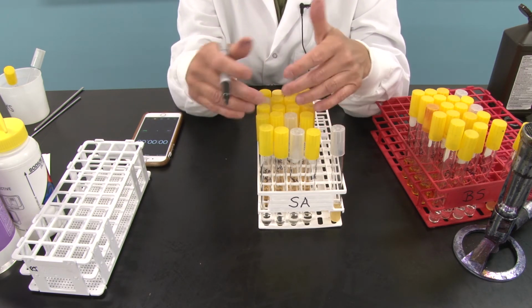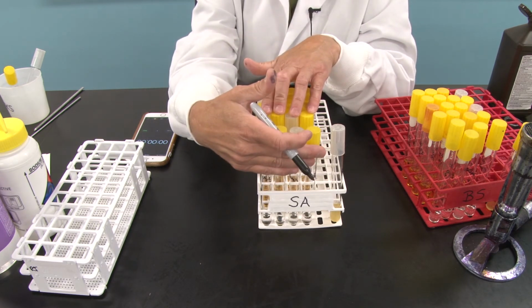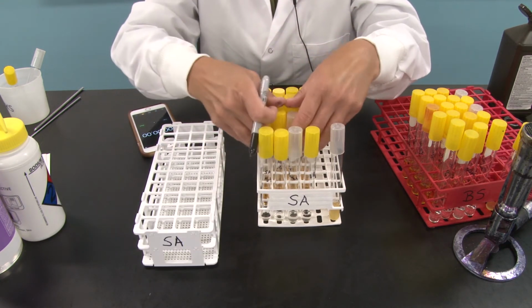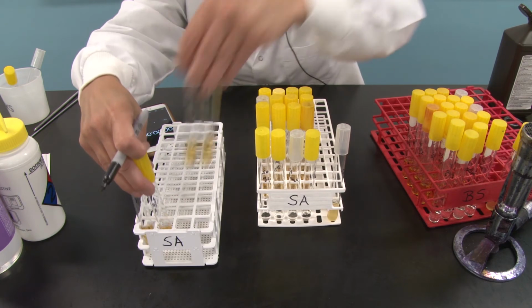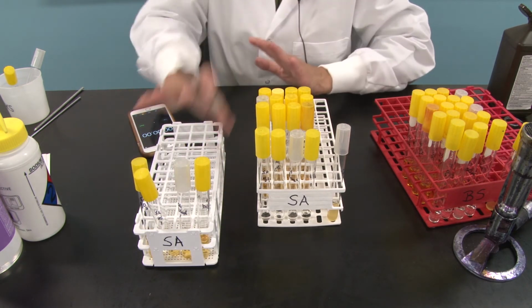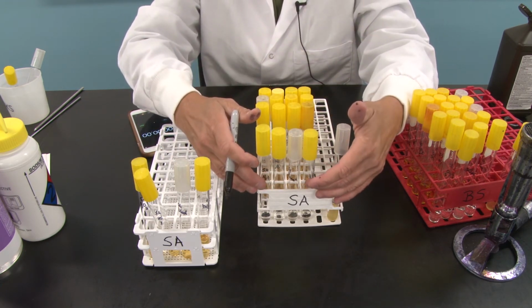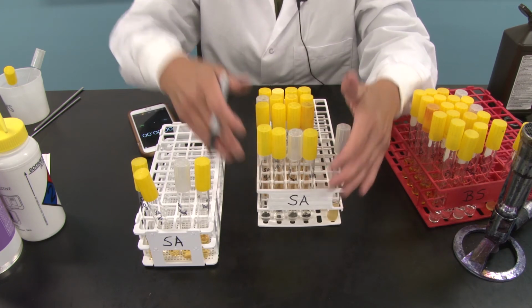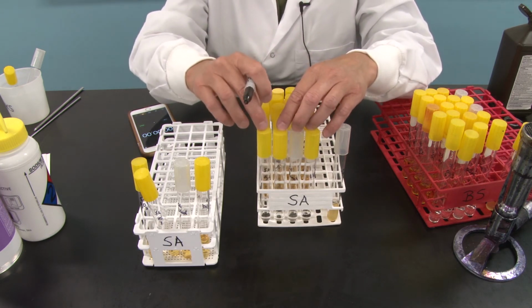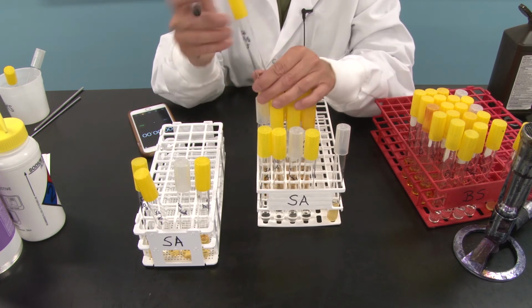And as soon as I've inoculated all 4 of these, I'm going to keep the timer running because these are still sitting in their tubes. But I'm going to take these and move them over to this rack once I've inoculated them so that I can put them in the incubator later. But I'm just going to sit them there and keep that going. But these tubes, the bacteria are still being exposed, aren't they, from the initial inoculum? So when the stopwatch gets to 5 minutes, I'm going to take another loopful of each of these and transfer it to this set of 4 tubes. And guess what they say?